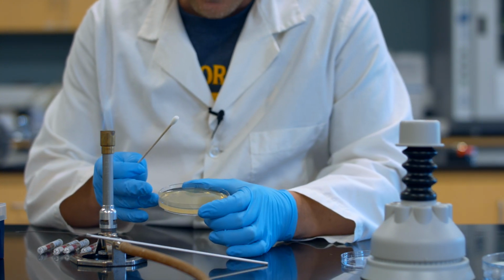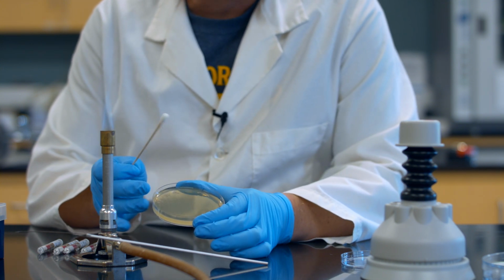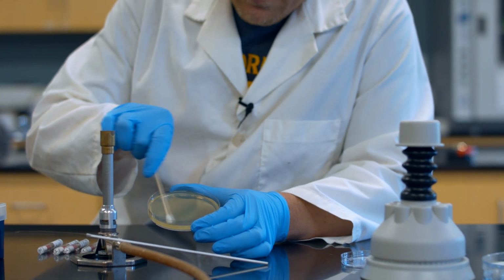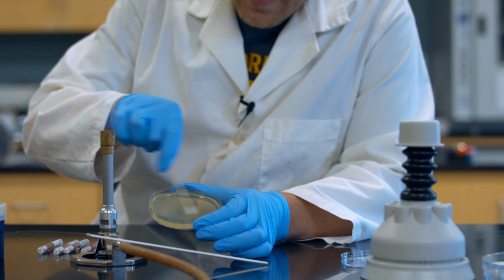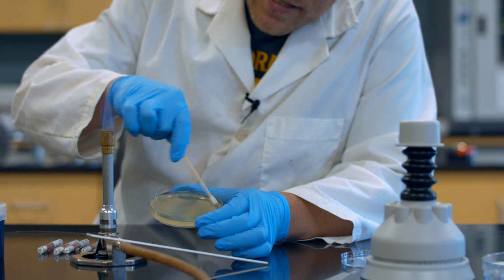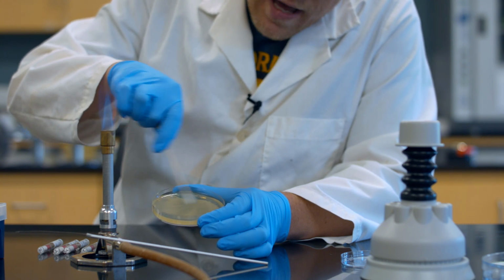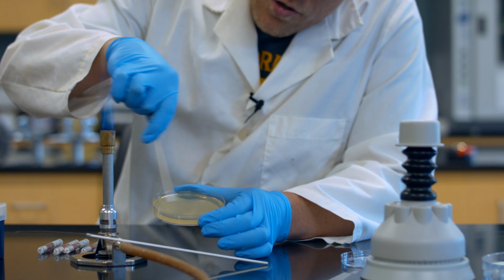I can actually see the lines on here in the reflection of where I just was. I'm going to turn it 90 degrees to how it was before, and I'm going to redo it at a 90-degree angle. So these lines, these swab marks, are 90 degrees to the original ones that I put on there. And again, imagine it's like red paint. You want overlapping strokes that leave no gaps at all. Don't be in a hurry. Overlapping strokes, no gaps at all.